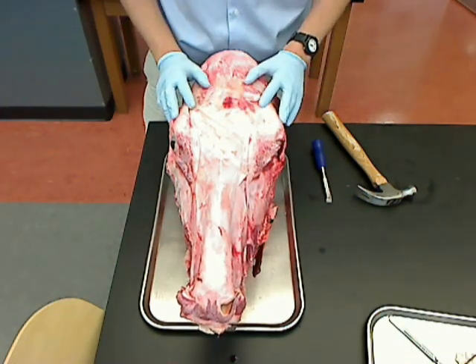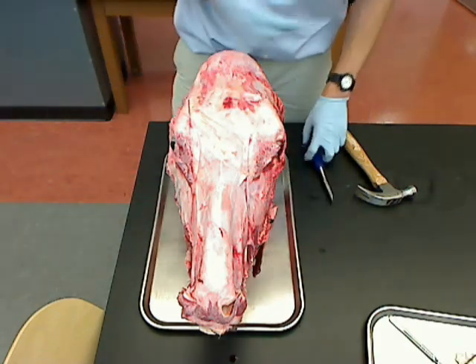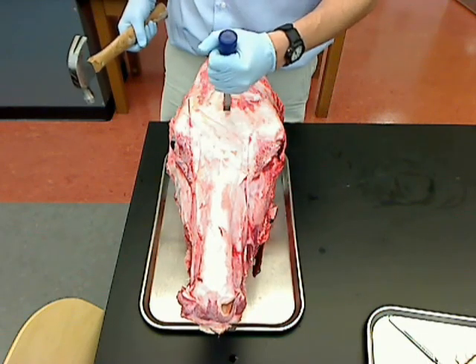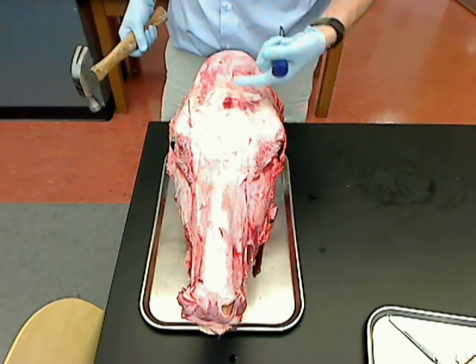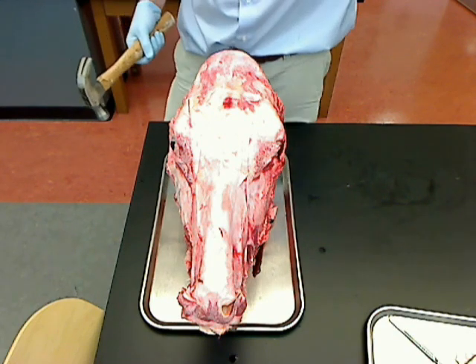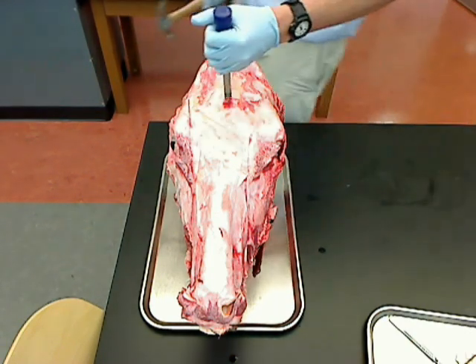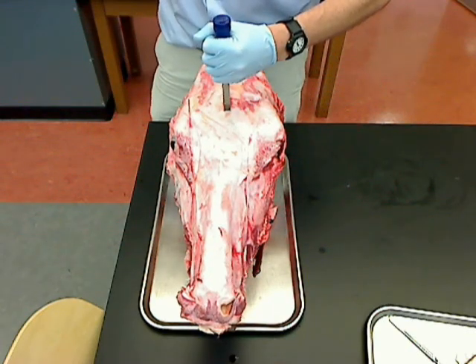So if we were doing an autopsy right now, as soon as you reflected the skin on the forehead you would have seen that. Here comes the fun part. The cow's brain case is actually just behind the eyes, and I have a dissected skull from a previous operation like this that I used to make sure. If you notice on this one, I started chiseling in the wrong place.